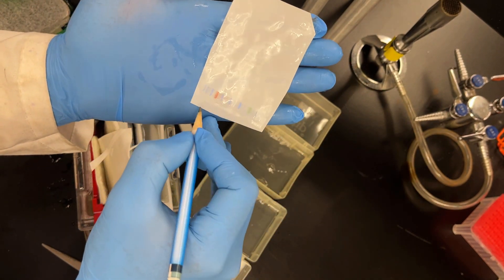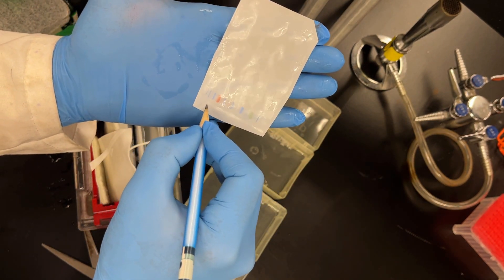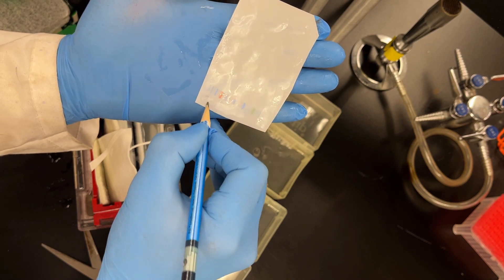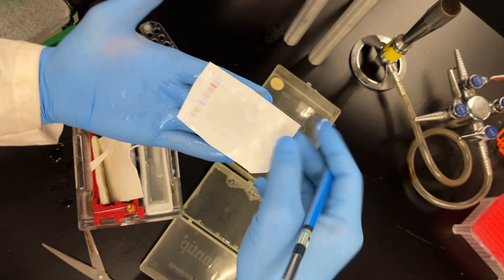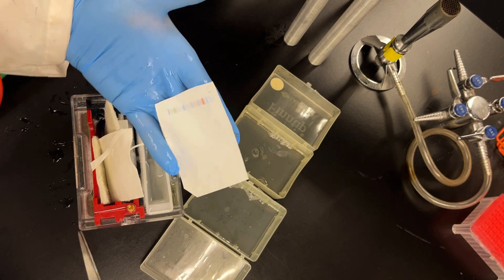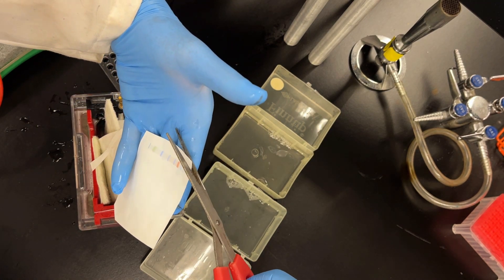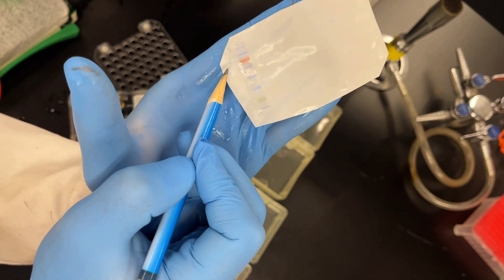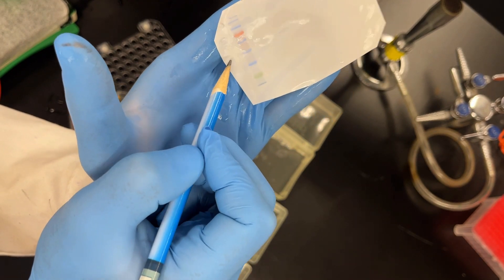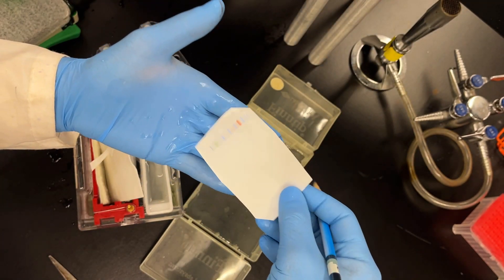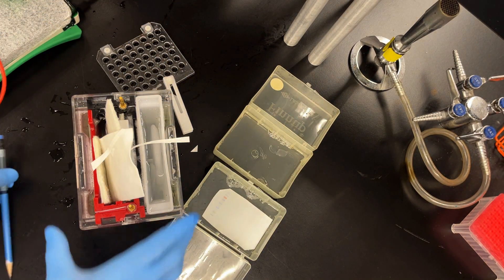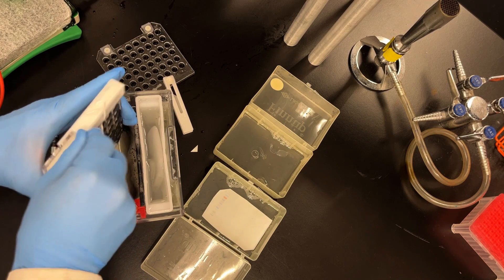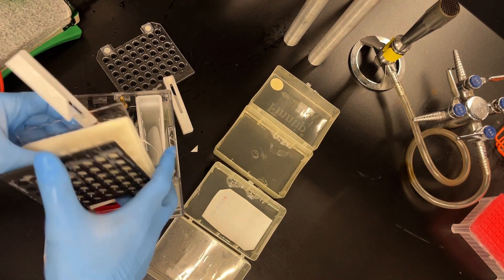You can save the gel. You can work with a pencil as well. And this is my blot number two. I cut the bottom left. And then there it is. Now I remembered. Don't forget, cut your top left. And this is a pre-stained ladder. So your ladder should have transferred. And you can see how it transferred very nicely. And then in that right orientation. So now this way, because of the way I transferred it, it's a ladder on the left. That's lane one on the left. And then it kind of moves forward from there.